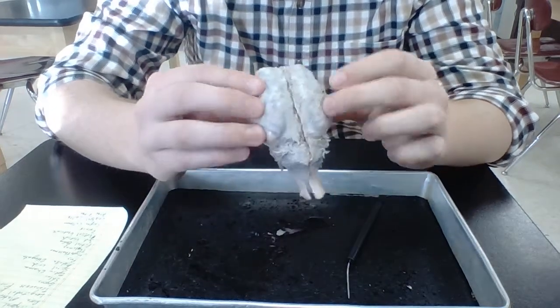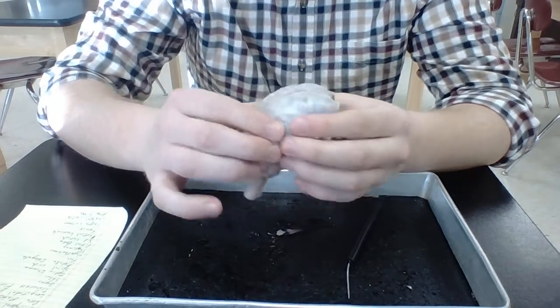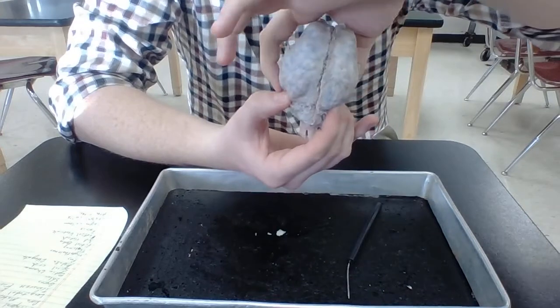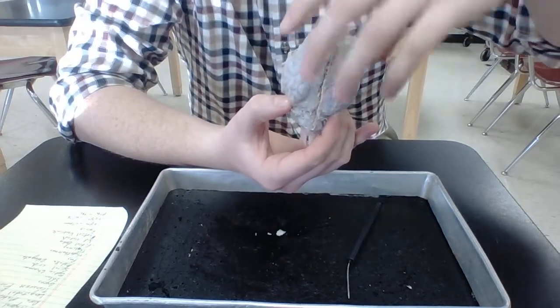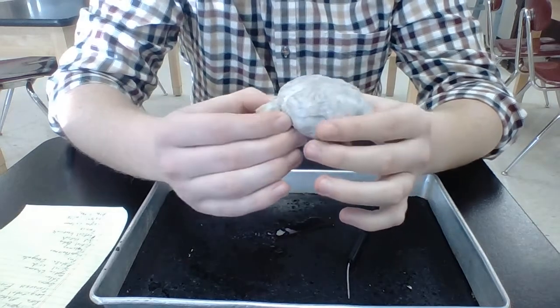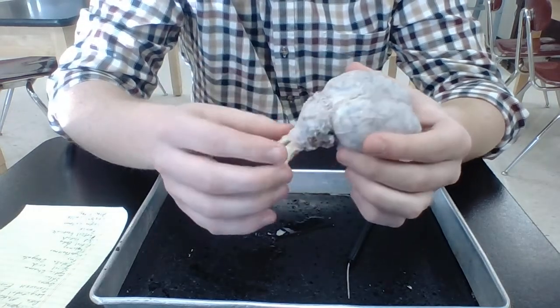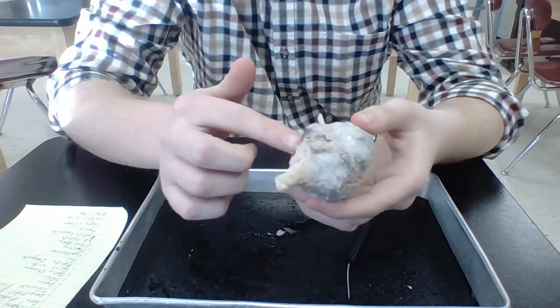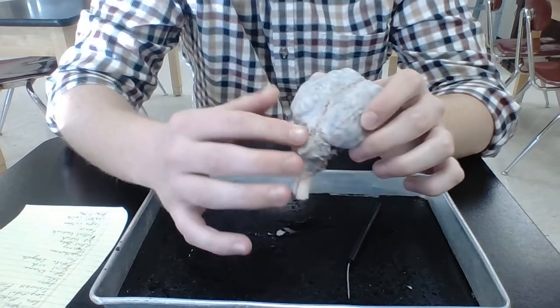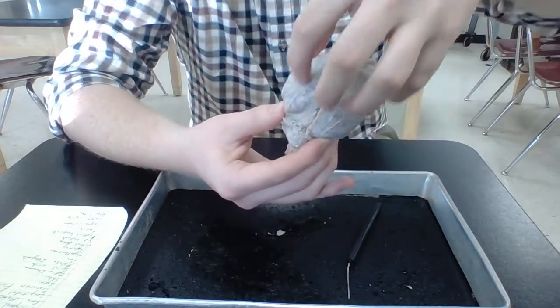All right, so we're just going to take a look at the outside of the brain. All right, we're going to cut it in half yet. So this whole thing from about here on is called the cerebrum on top. There's a number of different lobes a part of this. Down here at this part we have the cerebellum, and then you get the spinal cord into the brain stem down here on this part. So this is the cerebellum, down here, this little bell shape at the bottom, and then the cerebrum is this thing on top.